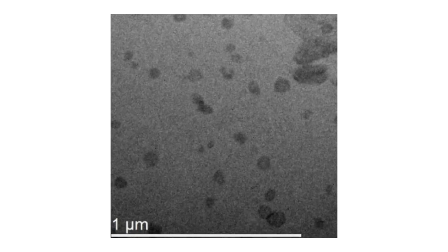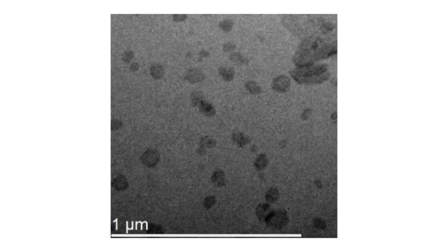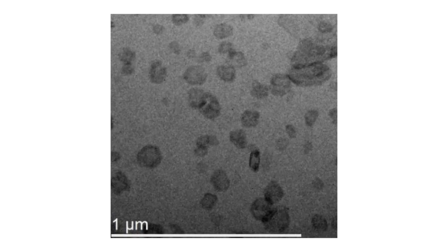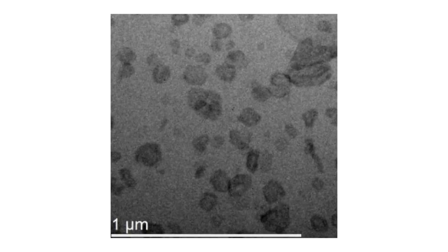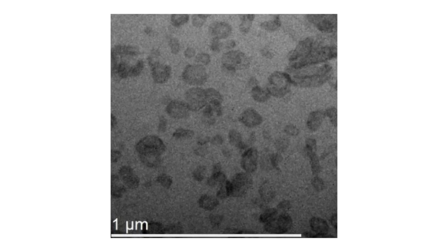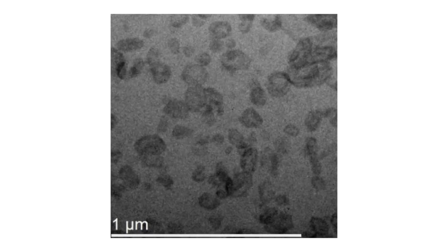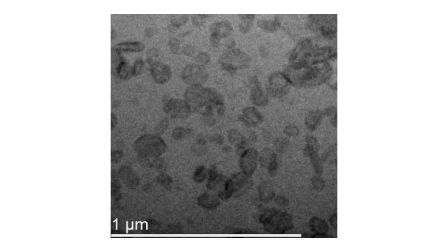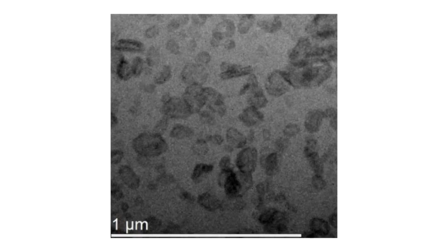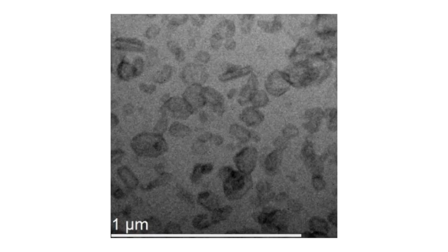When I put a liquid inside this box that contains molecules of the pharmaceuticals, we can see things happening, as you can see in the video playing at the moment, where crystals just form out of the blue as if there's nothing there in the first place. So these kind of processes we can see in real time, and it's absolutely incredible. Using this kind of transmission electron microscope, we can see these processes even down to the atomic scale.